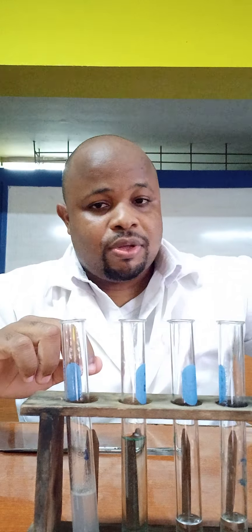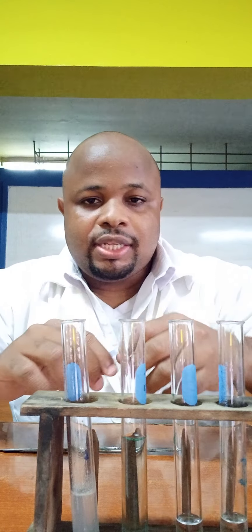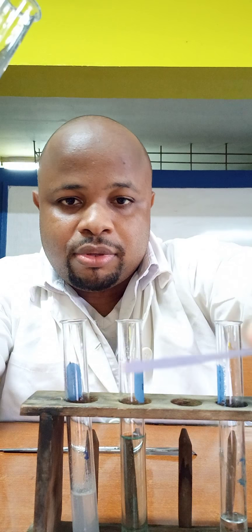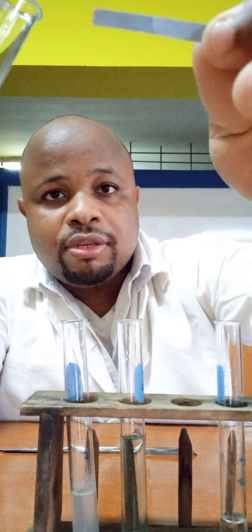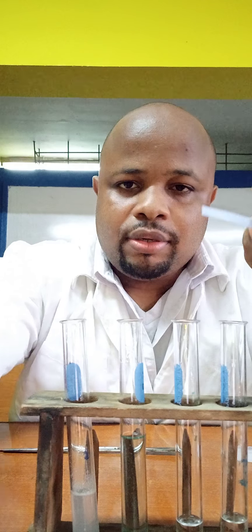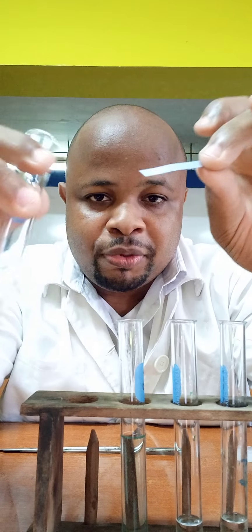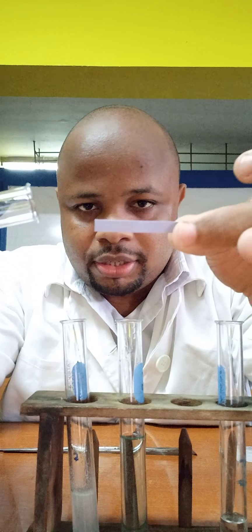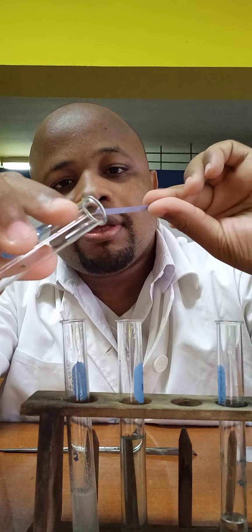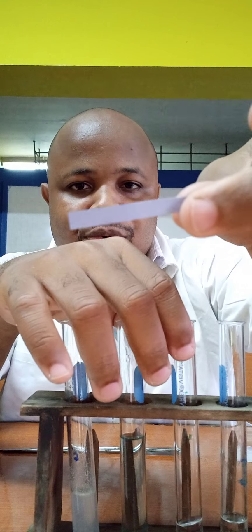Now we're going to test the acidity of the compounds using blue litmus paper. This is liquid A — I'm going to run it down and allow it to touch the litmus paper. Using a new piece of litmus paper that is completely blue, to make sure any change is because of the liquid. As you can see, there is no change in the color of the blue litmus paper for liquid A.